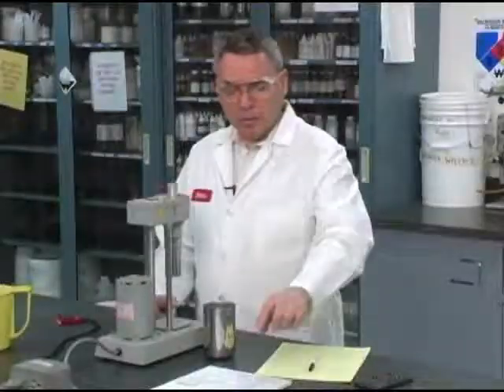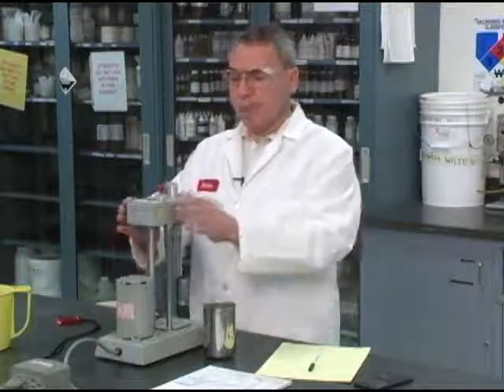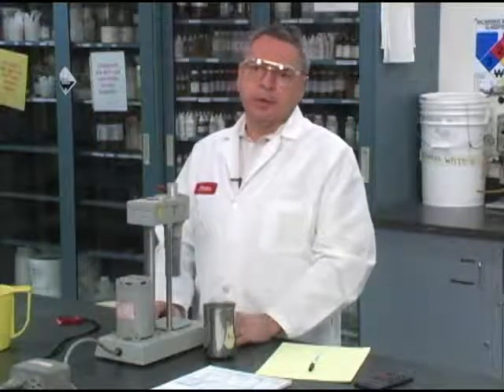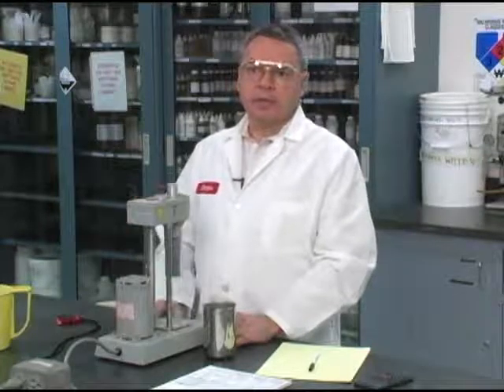Our next step, according to the list we have here, would be to measure rheology. We are going to do this using a rheometer, which is going to allow you to measure 6 dial readings. This is a 6-speed device. We can measure plastic viscosity, yield point, and gels.